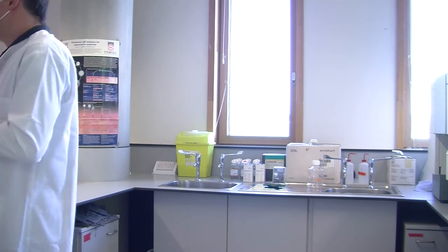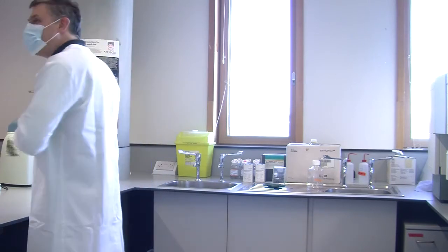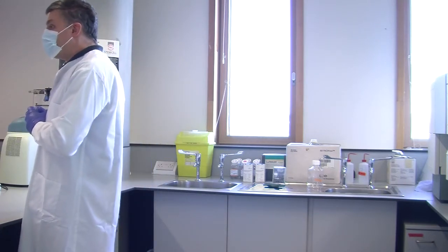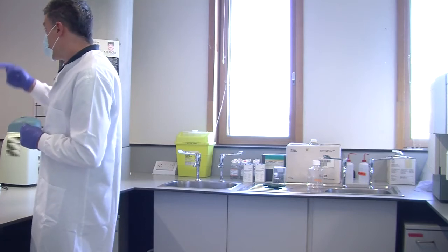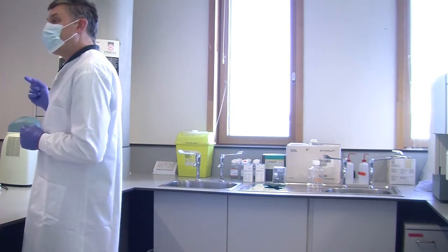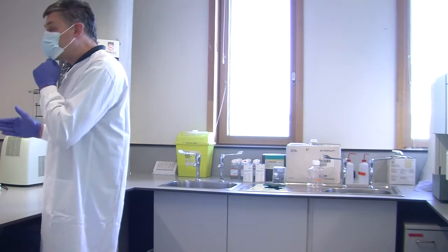Well, we need to be positive because we have five people who do the same thing, so hopefully one of them will get it right. Having said that, with practice, I actually tested myself once. I used a cell counter and tested it at each stage to work out what I'd lost. I think I got my losses down to about 3% over multiple washes.